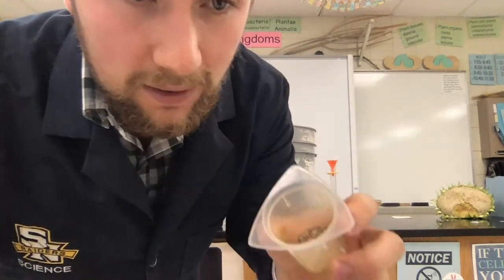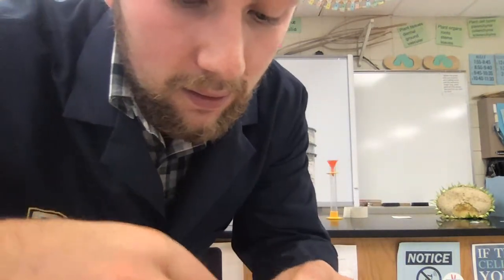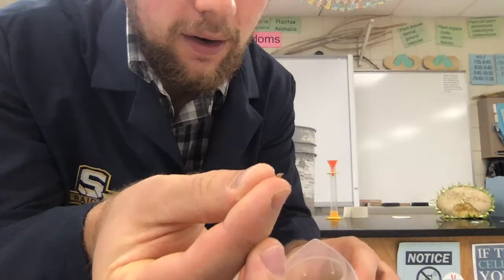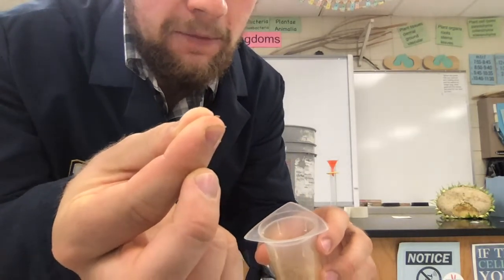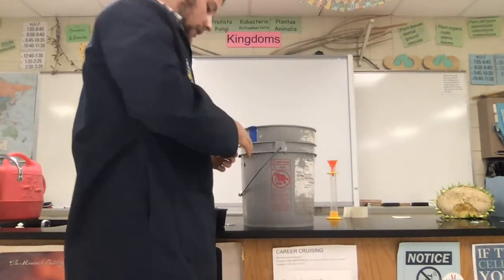They come in this tiny container. They are very tiny. They are pretty hard to even see on the finger. They're about the size of a fingernail in width, so they're very tiny. So I'm going to plant them. I apologize if you can't see this part real well.